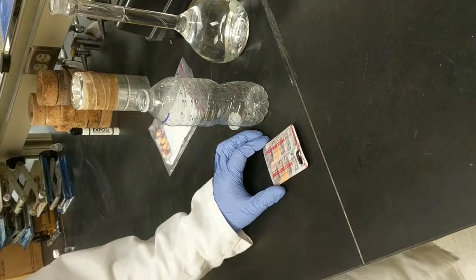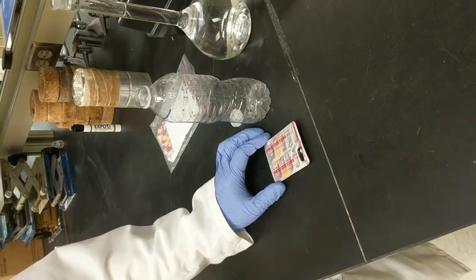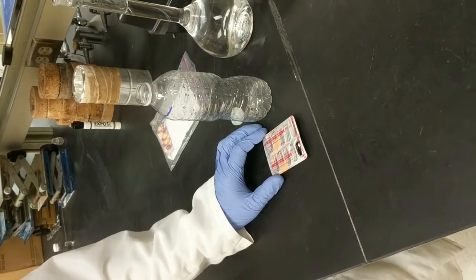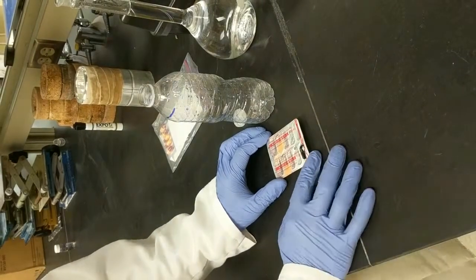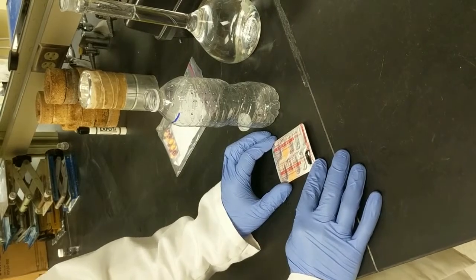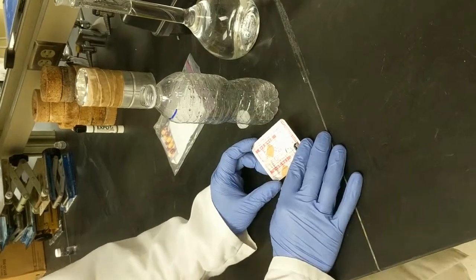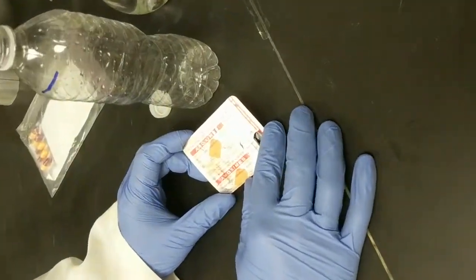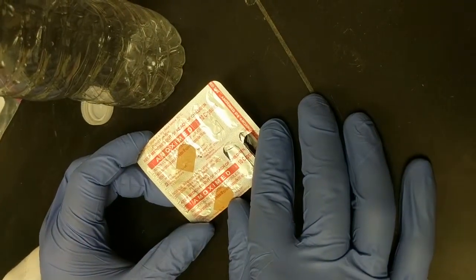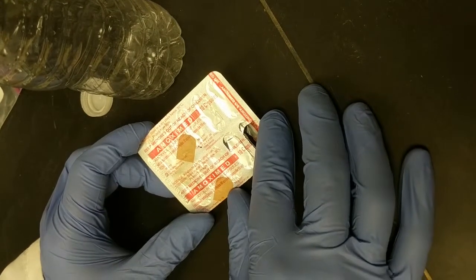Today I'm going to show you how to prepare a beta-lactam antibiotic sample for analysis using a test card technique that we have developed. The first thing that we need to do is to prepare the sample for analysis. Here I have a sample of amoxicillin that we collected in the marketplace of Kenya, and we need to create a nominal 1 mg per mil solution of this.